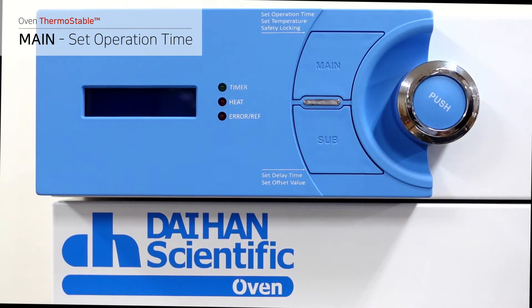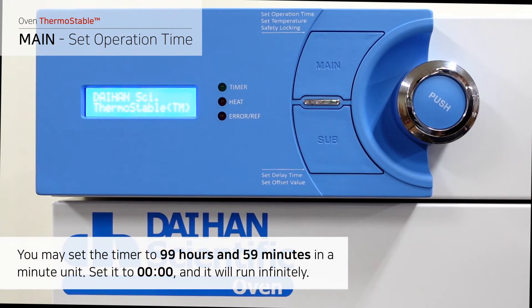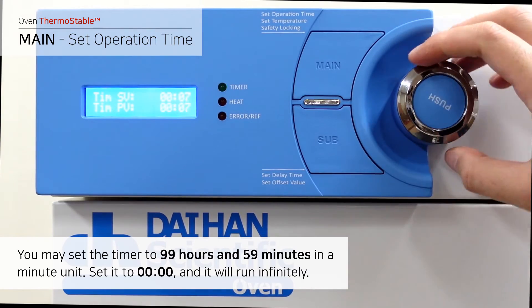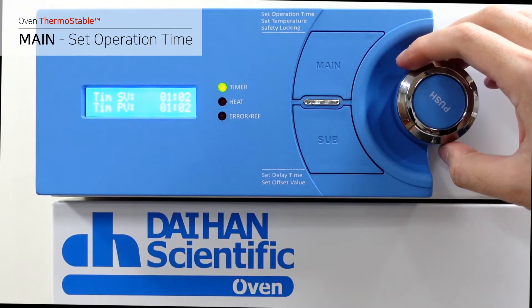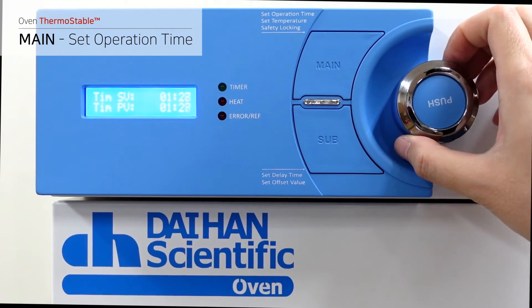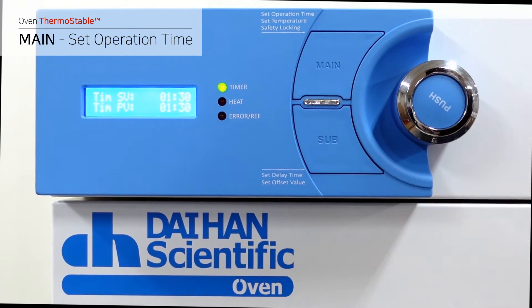When you turn on the power, you'll see the timer setting mode. You may set the timer up to 99 hours and 59 minutes in one-minute units. Set it to zero and it will run infinitely. Set the time you want, press the push button, and the timer will start. The timer LED indicates whether it is working correctly, and the alarm sounds when the timer runs out.